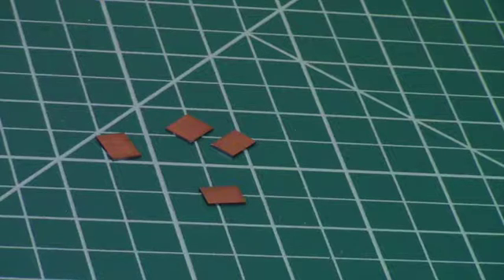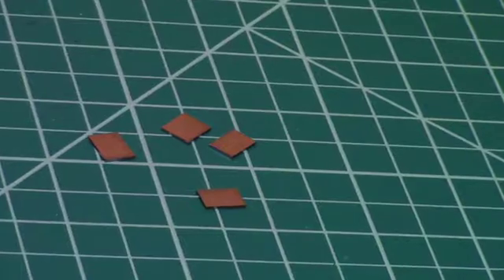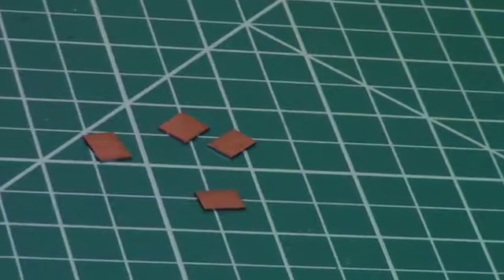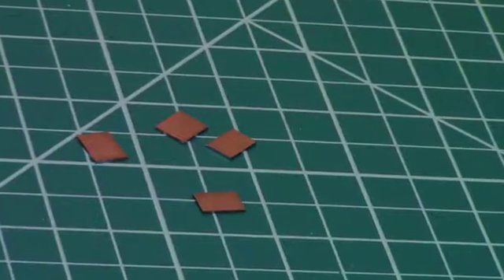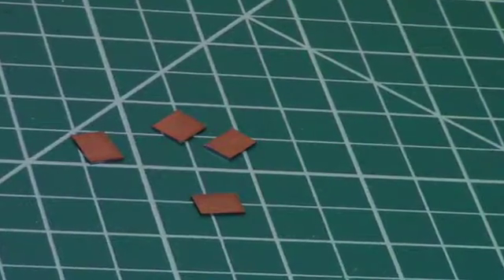Start with samples that are about three quarters of an inch or 20 millimeters on a side.